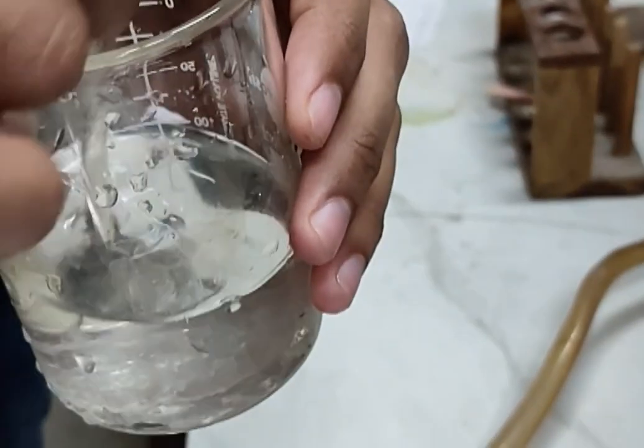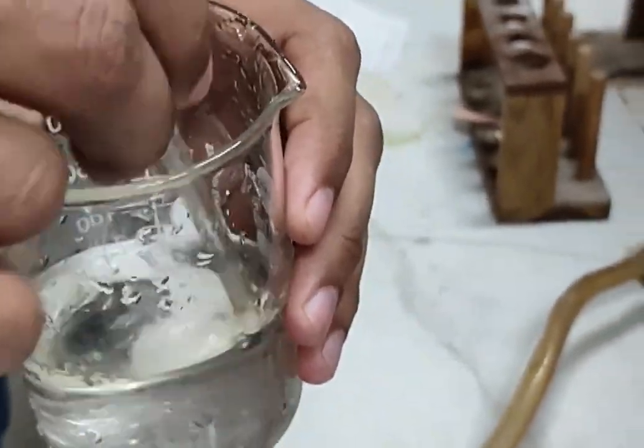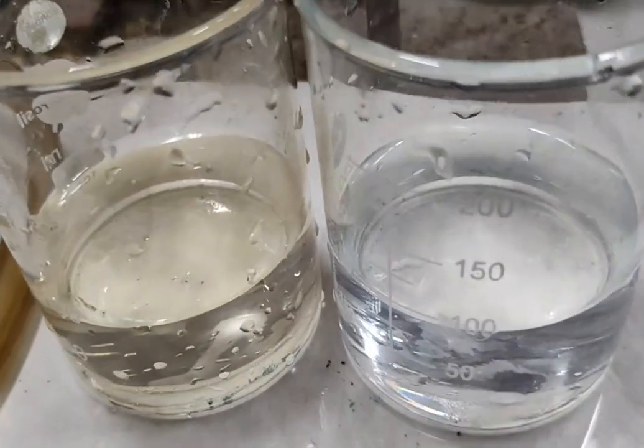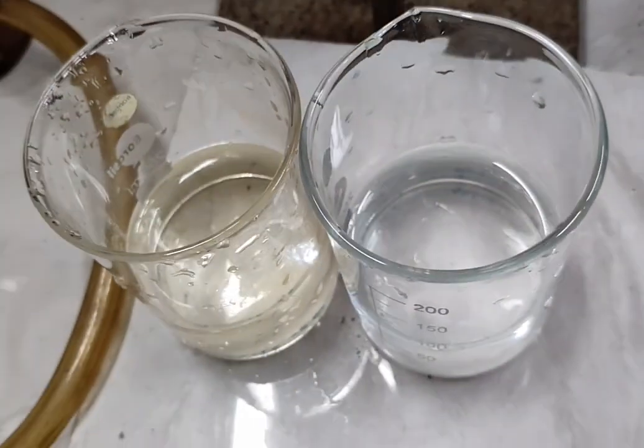We have a sodium acetate trihydrate solution, 100 ml solution. So this is the final solution.